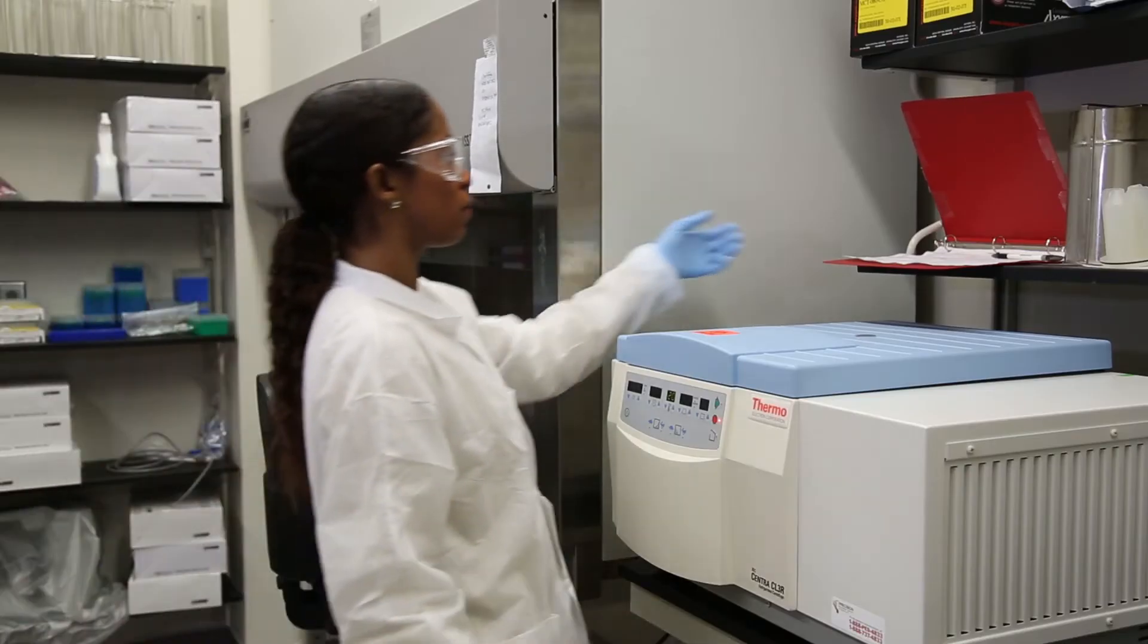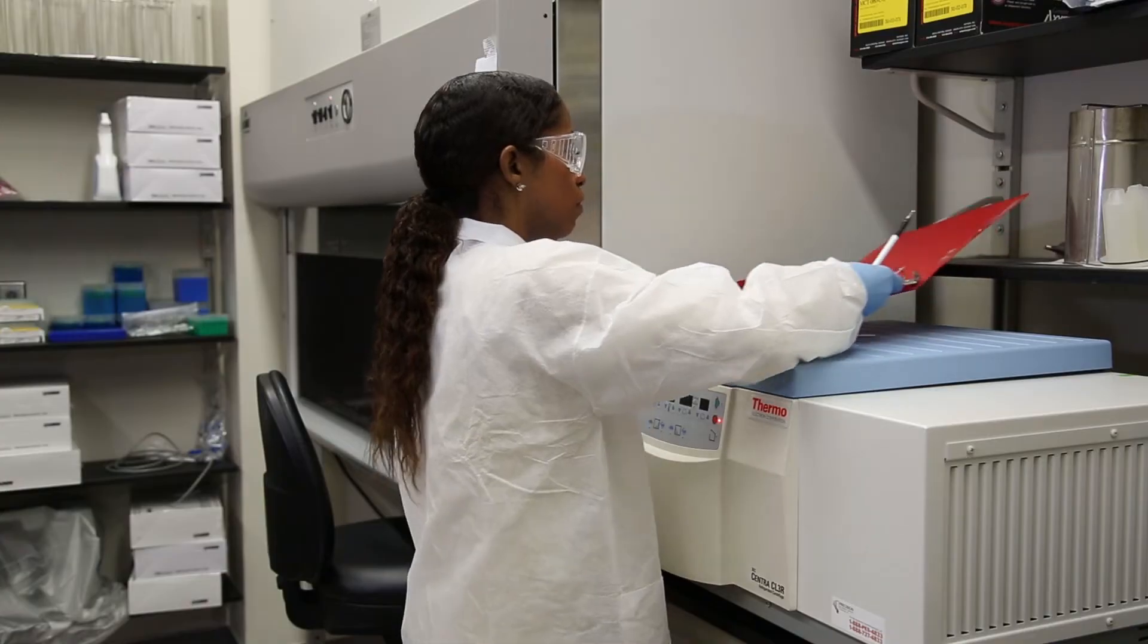If your lab keeps a usage log, be sure to sign the BSC log form.